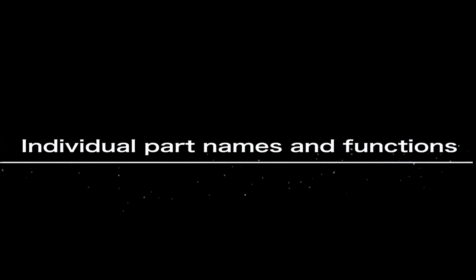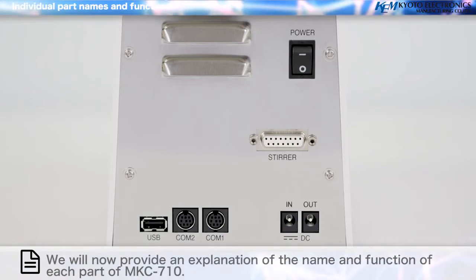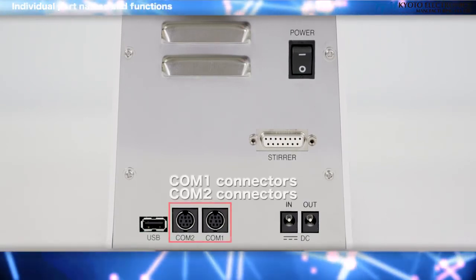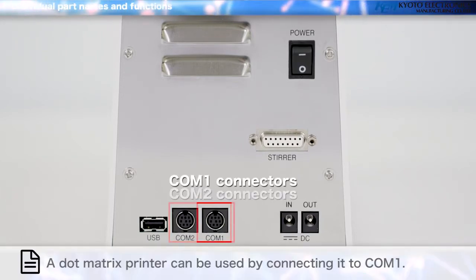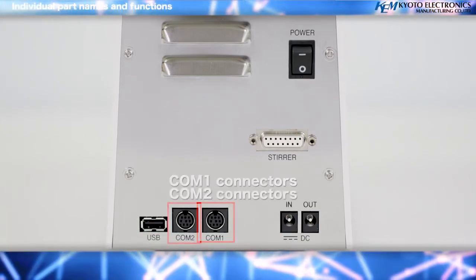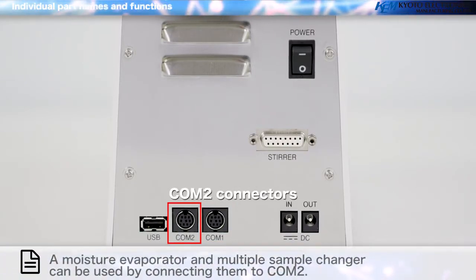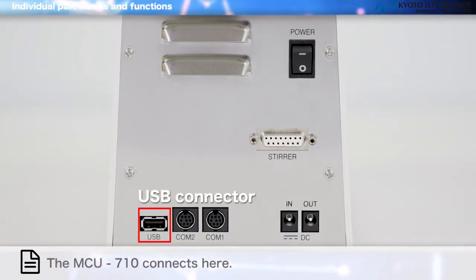Individual part names and functions. We will now provide an explanation of the name and function of each part of MKC 710. COM1 and COM2 connectors. A dot matrix printer can be used by connecting it to COM1. A moisture evaporator and multiple sample changer can be used by connecting them to COM2. USB connector. The MCU 710 connects here.